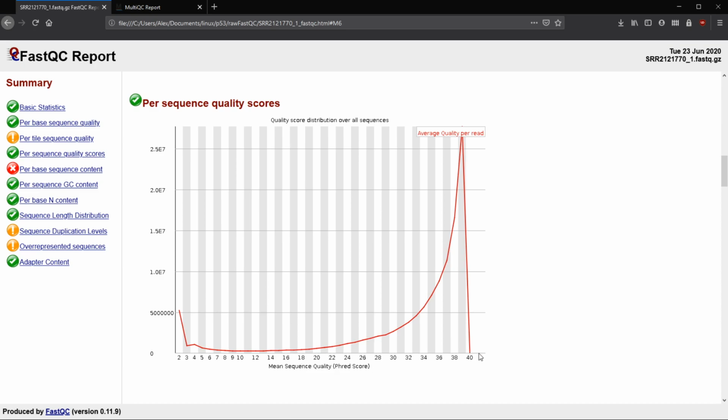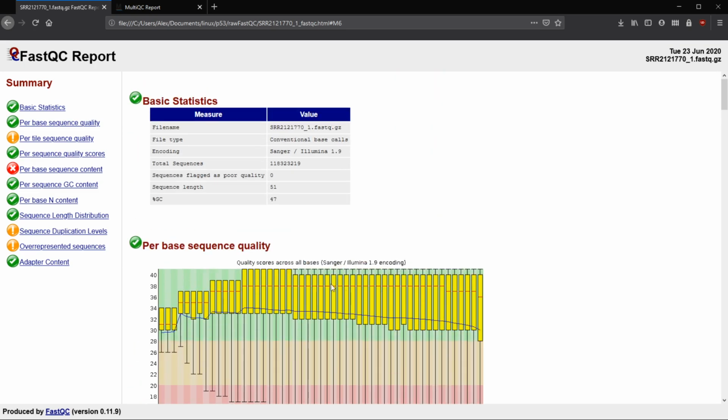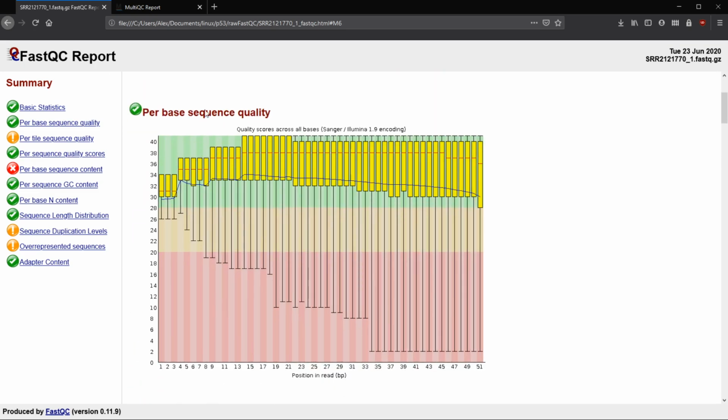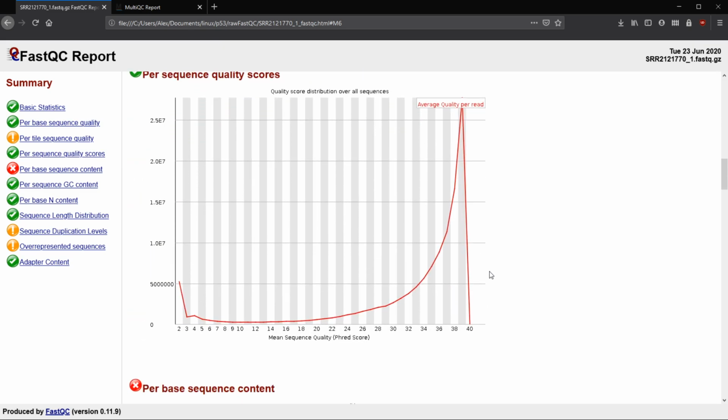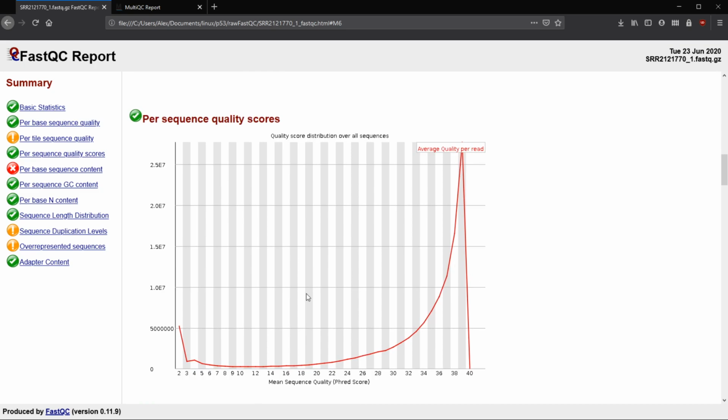So here, this is rotated from the first graph. We have our quality scores across the x-axis, and the number of reads along the y-axis. So we can see most of the reads had a quality score that was rather high, so 38. Most of them, we could say it was probably greater than 30, which is really good.